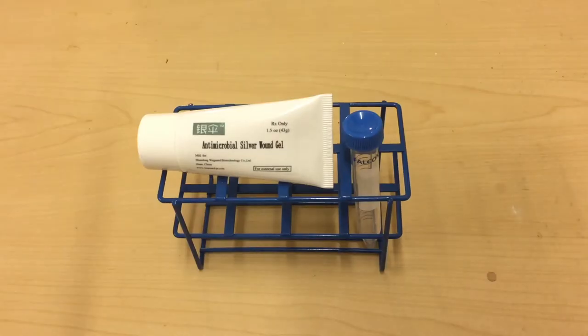This gel tube material itself will not withstand steam sterilization. We will transfer gel from this tube into a conical bottom tube with blue cap.